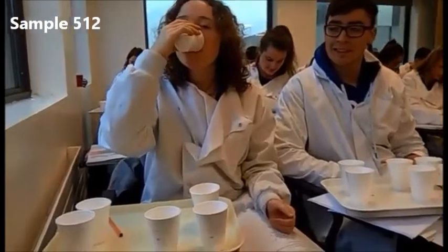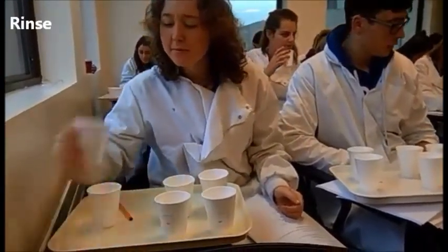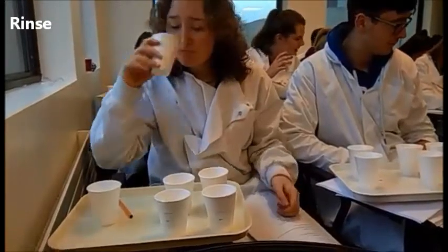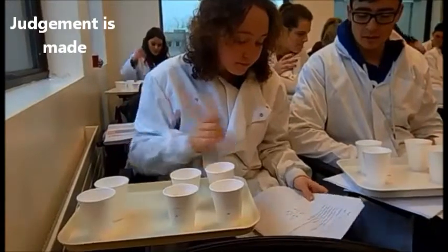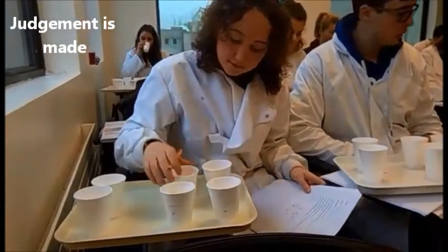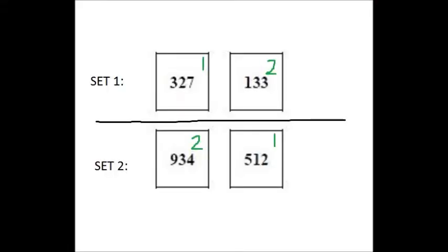She now proceeds on to the final sample, 512. She tastes the sample. She rinses with water and she spits the sample back into the cup and proceeds to make her judgment, labelling the sweeter cup with a 1 and the less sweet sample with a 2.